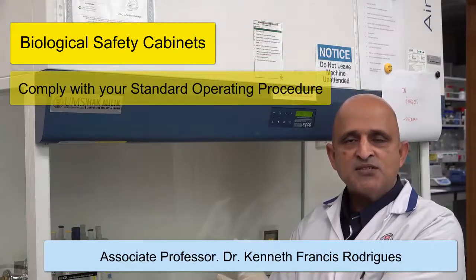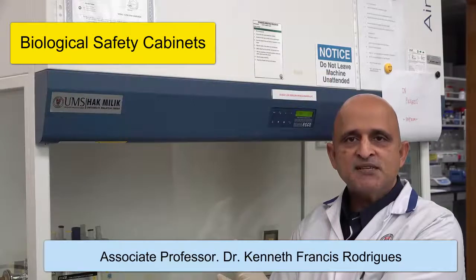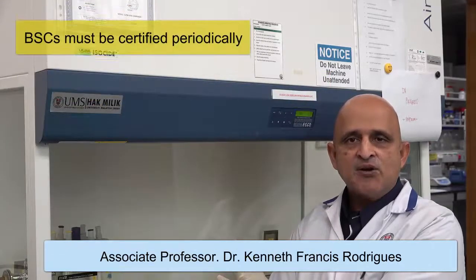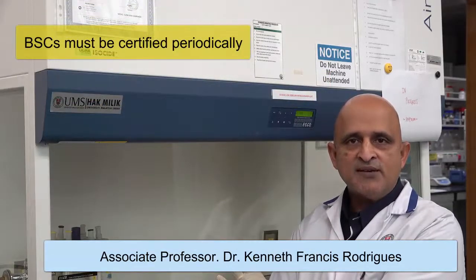Every biological safety cabinet must be certified periodically in compliance with your local regulatory authority or your national standards.